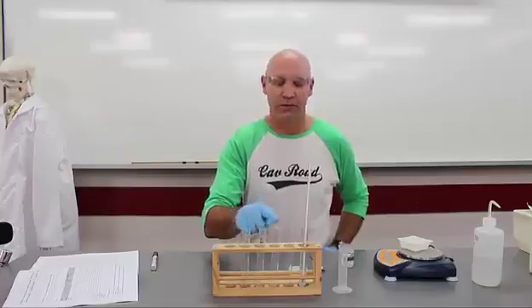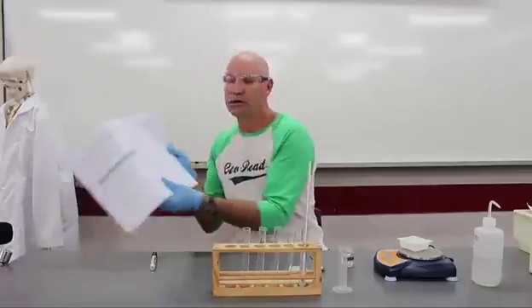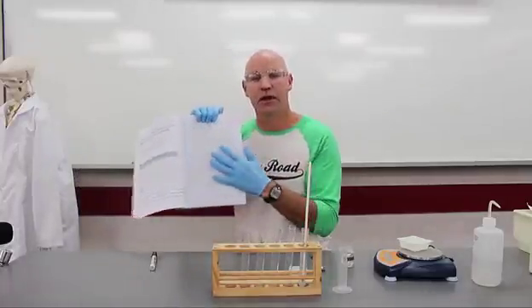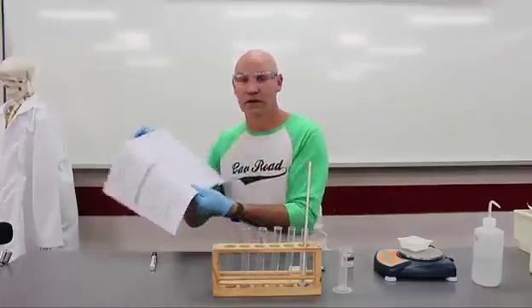1 gram, 2 grams, 3 grams, 4 grams, 5 grams. And after you've done that, and you've got all of your data in there, I'm going to ask you to plot that on a graph and then do some thinking, some analysis. Okay, good luck.